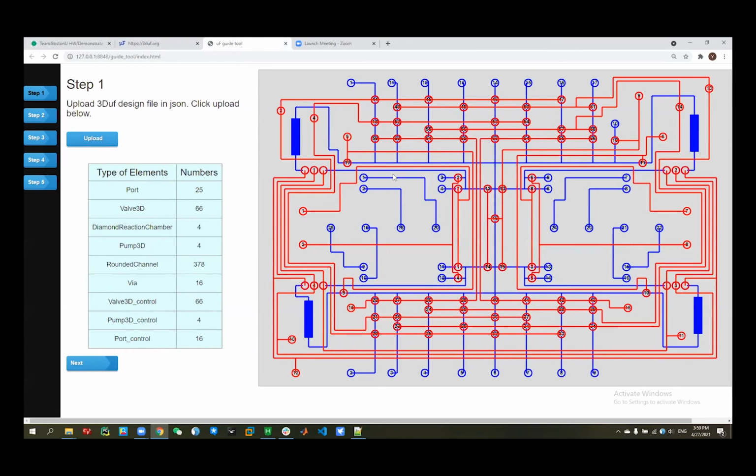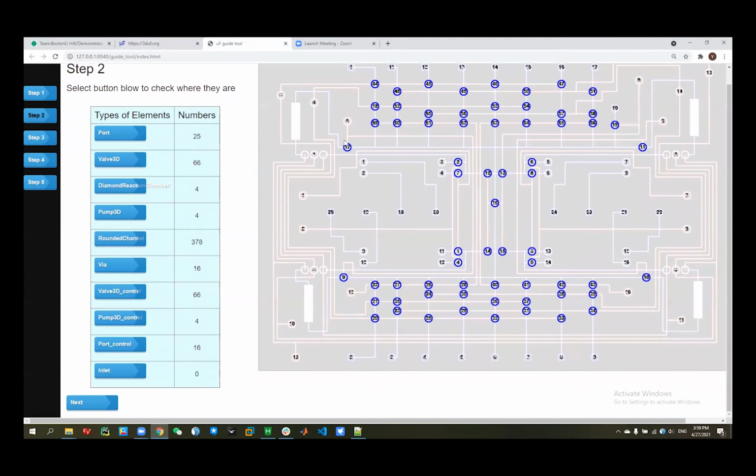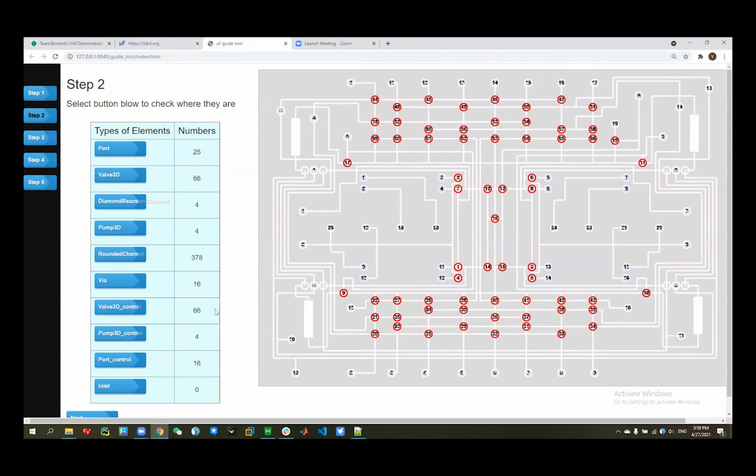So that is the motivation for us, because a device that looks like this is very hard to control manually. So we want to have something provide a guidebook for us to automatically control it, or control it manually but quickly. Then we can see the components information here, and then in step 2 we can see where they are, and they are colored here, and via, and just see here. But in the step 2 we have the most important task.